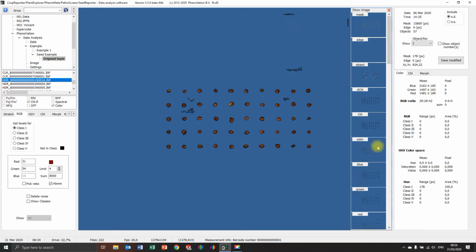One way to also solve this, if it's only one image and you really want to analyze that one image in detail, you can, of course, do the eraser thing. You just erase it like that. And now you will have the perfect image. What you then can do, if you like this, is say save modified.